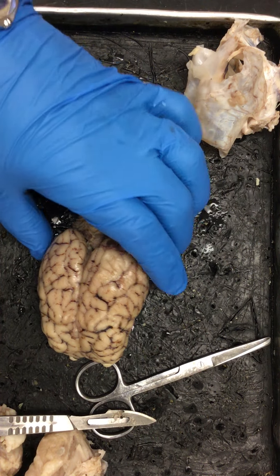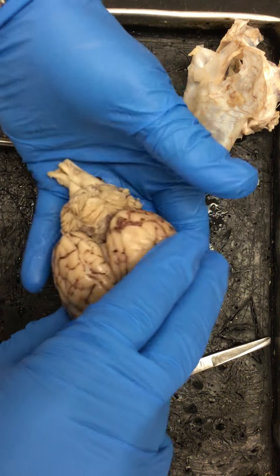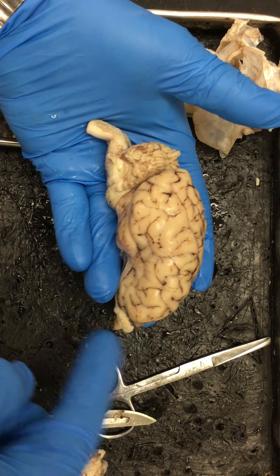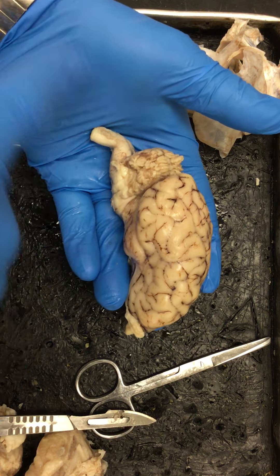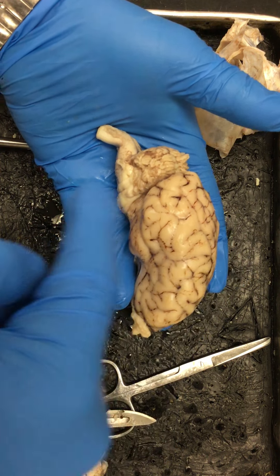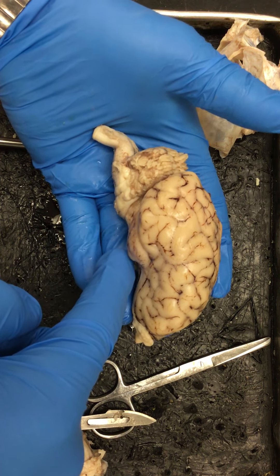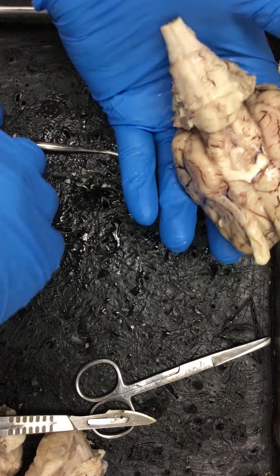Next we're going to take a look at the ventral side of the brain — this is actually the dorsal side of the brain. If you can imagine, this is your sheep: top of their brain, bottom of their brain, little sheep eyes, nose, mouth down here, back to the rest of the sheep. Dorsal is always on the top or toward the back. Ventral is always on the bottom or toward the stomach of the animal. So we're going to look at the ventral side to examine some key structures.